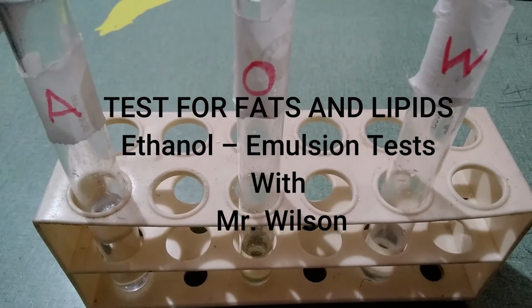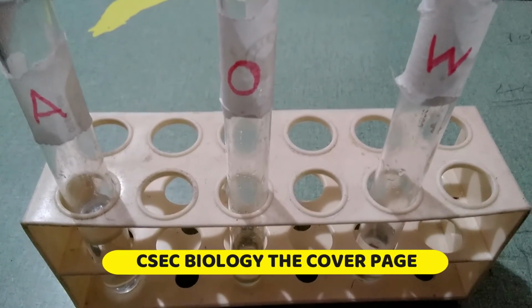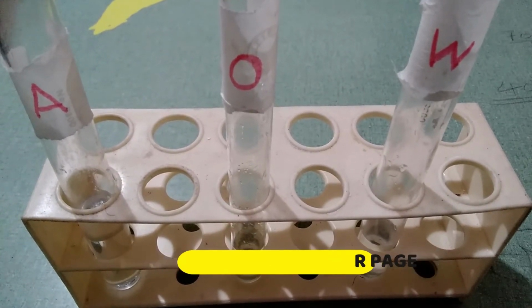Ethanol emulsion test with Mr. Wilson. We are testing for fats and lipids, and it comes to you from CSEC Biology, the cover page.